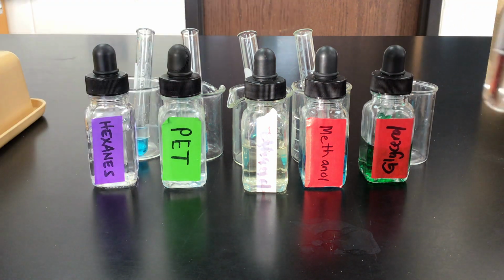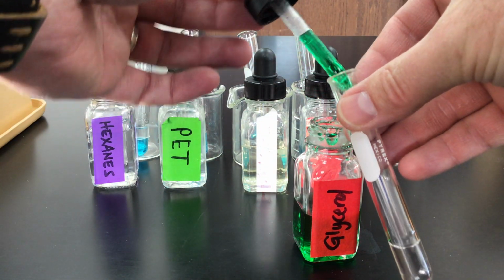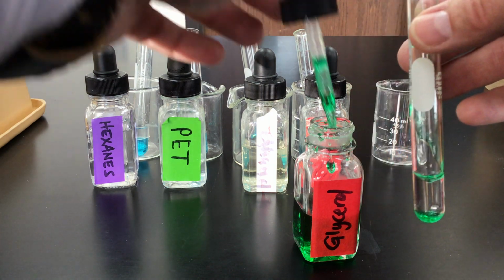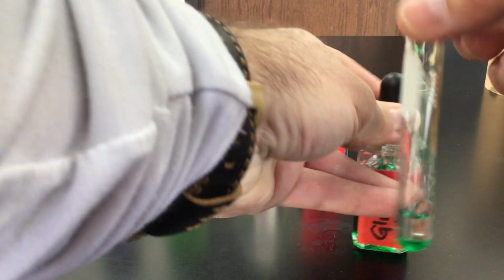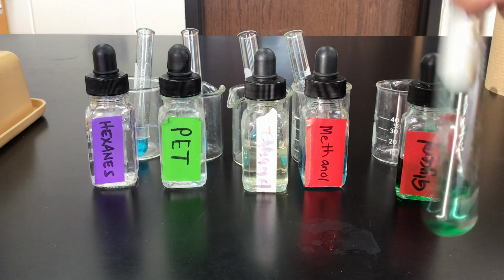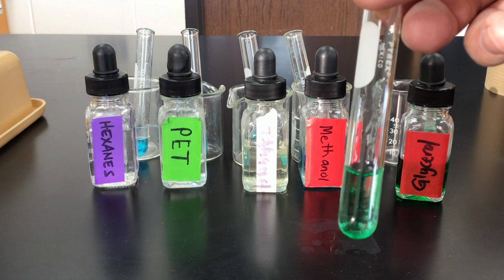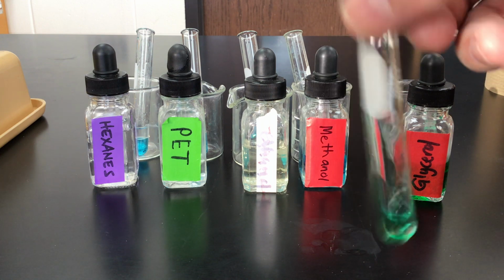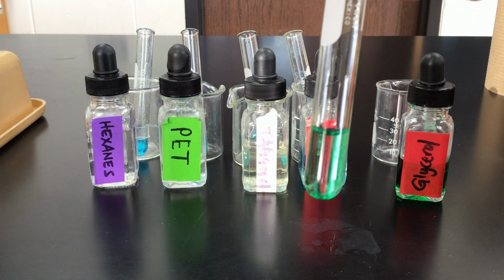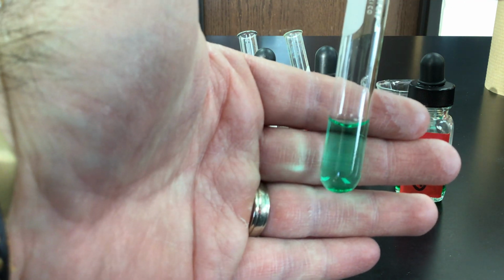Lastly, we're going to do the glycerin or the glycerol, which we dyed green here, and we'll add a little bit of that in here. It's so thick, it kind of just gets some in there. There we go. All right, and we'll give this a little shake. And when we're talking about solubility, we're talking about whether something will dissolve or not. We're not really speaking to how much it will dissolve. So we just want to know, in this case, will it dissolve, not necessarily how much. And what you can tell there by looking at it, the water has turned green. And so glycerin or glycerol is soluble in water.